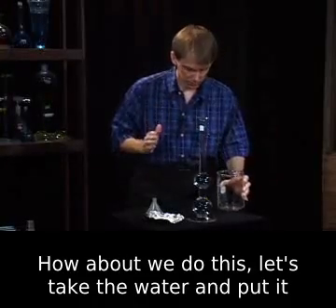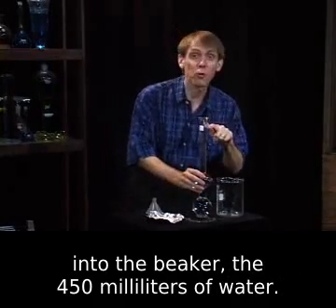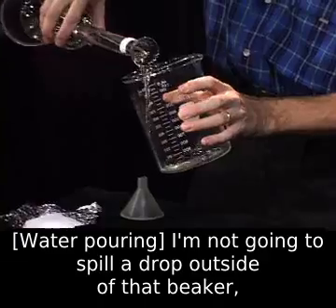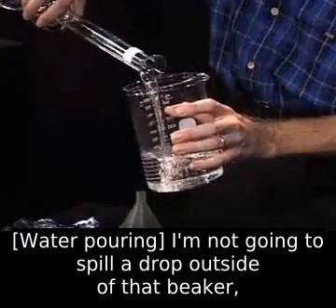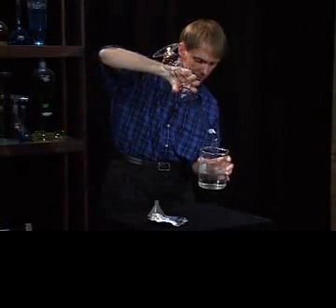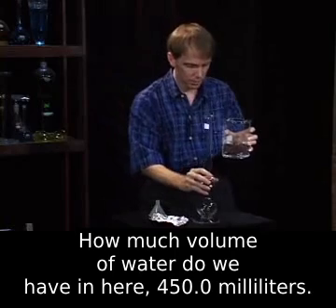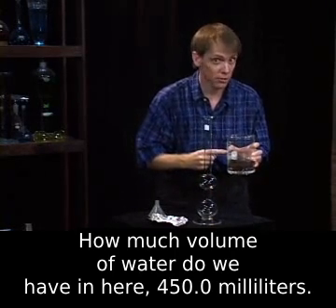How about we do this? Let's take the water and put it into the beaker. The 450 milliliters of water. And I'm not going to spill a drop outside of that beaker. It's all collected in the beaker. How much volume of water do we have in here? 450.0 milliliters.